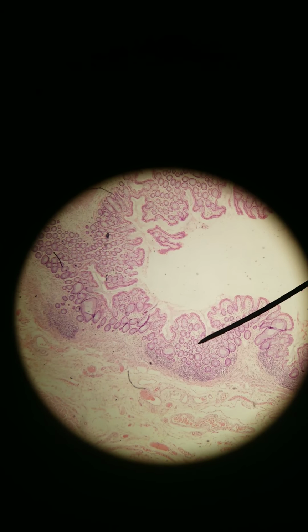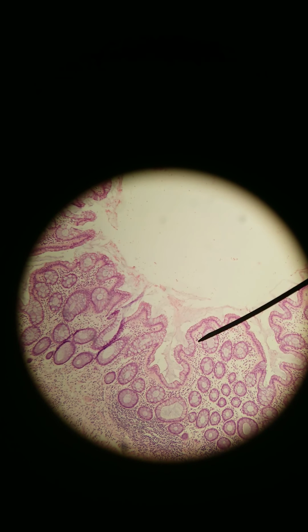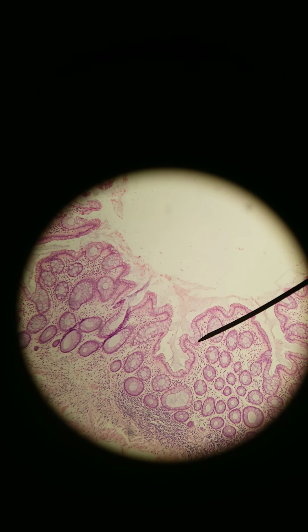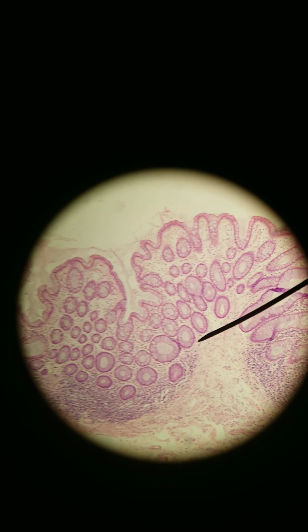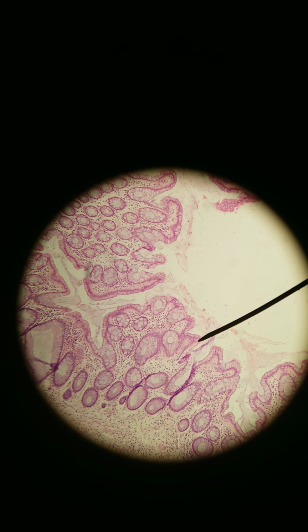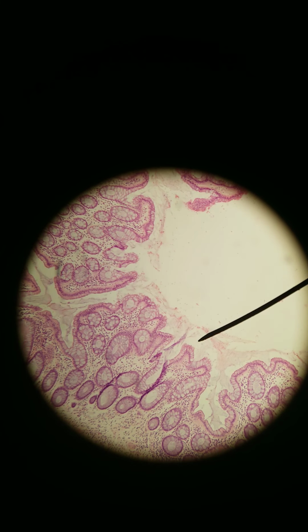By this point, we're storing feces in the rectum. So we still need lots of mucus. Those are the goblet cells. Lots and lots of goblet cells. You can see that we're getting a little bit more texture here to the mucosa. It's not just straight. The rectum can expand, of course, so that it can store feces, and then when we're ready, we can expel it, we can defecate it out.